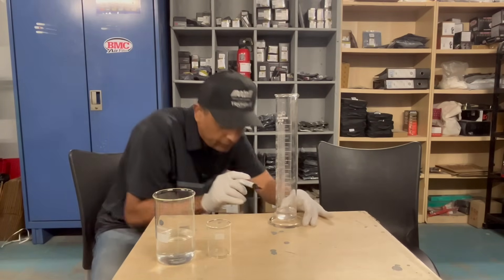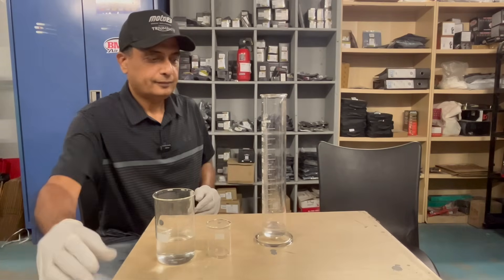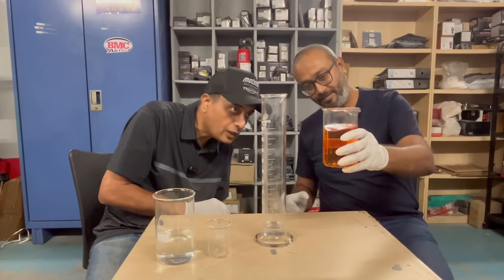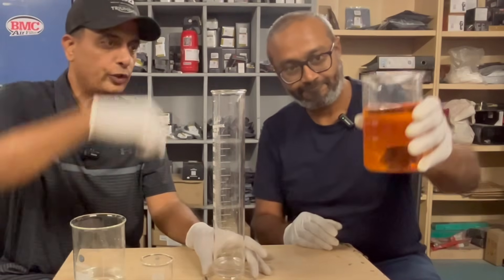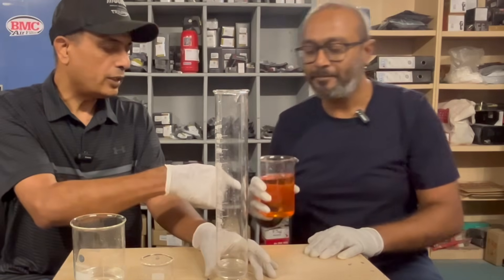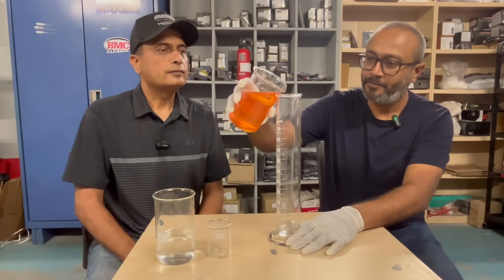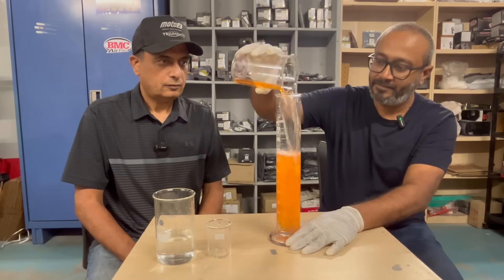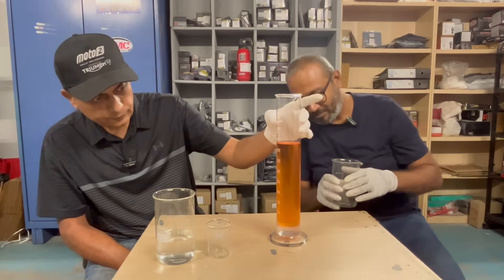I have marked approximately the 40 ml. Is that 400 ml? About more or less 400 ml — okay cool. Now why don't you put it into this? There is 40 ml of water here. That's 400 ml of E10 petrol — let it go inside here please.